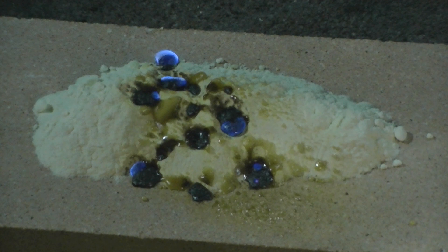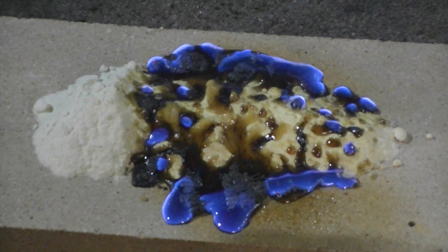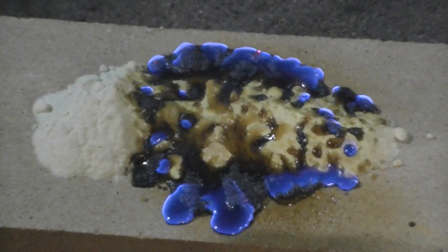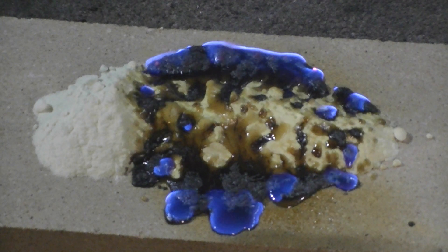As sulfur has a relatively low melting point of approximately 115 degrees Celsius, you can see some of the sulfur melting as the surrounding sulfur is burning, and the burning sulfur is burning with a characteristic blue flame.